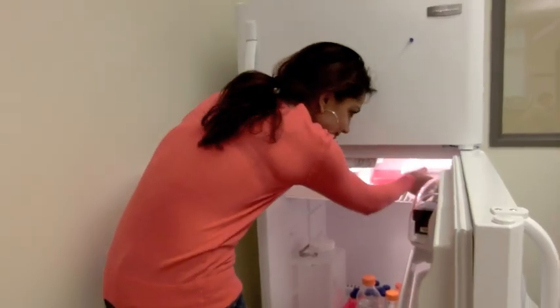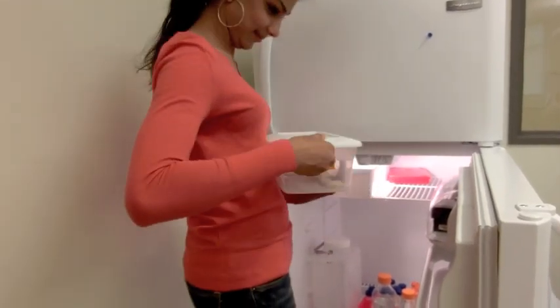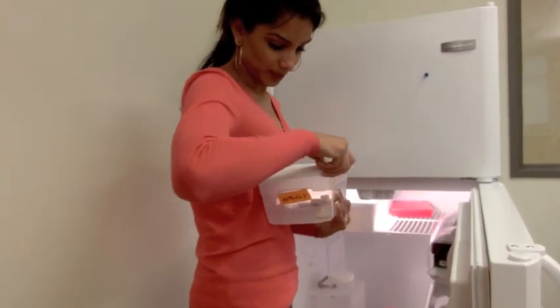Assuming you've already harvested and embedded your tissue samples in paraffin wax, obtain your paraffin cartridge from the refrigerator.